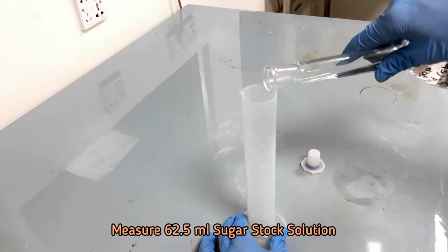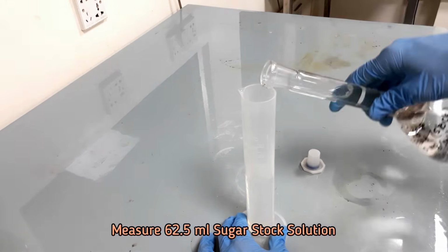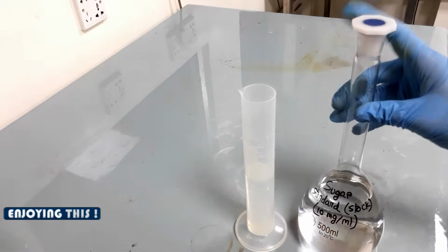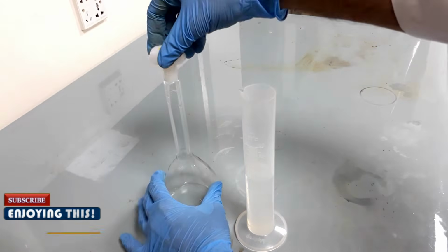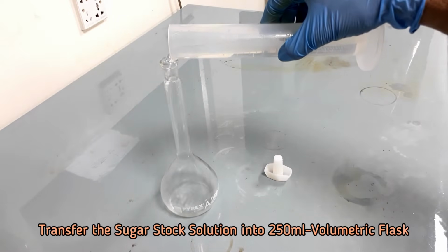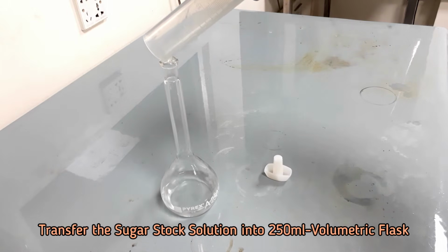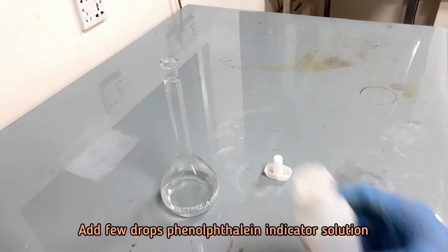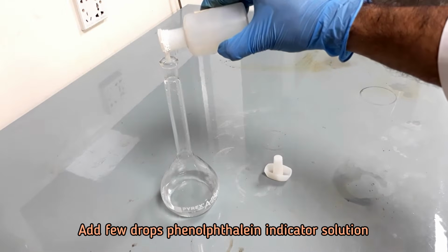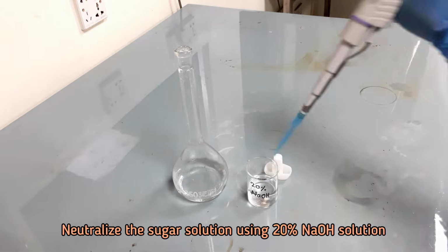Measure 62.5 ml stock solution and transfer into a 250 ml volumetric flask. Add a few drops of phenolphthalein indicator solution and neutralize with 20% sodium hydroxide.